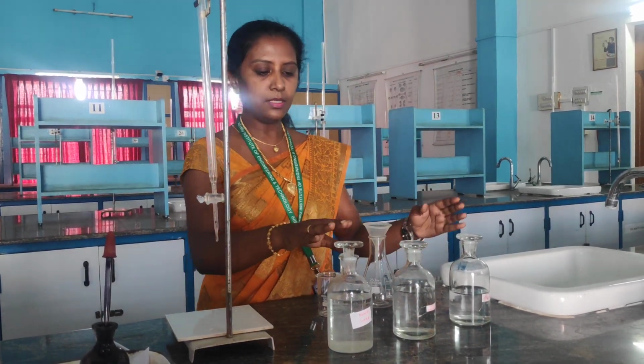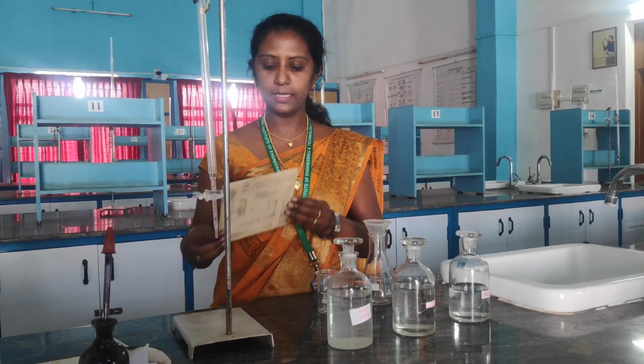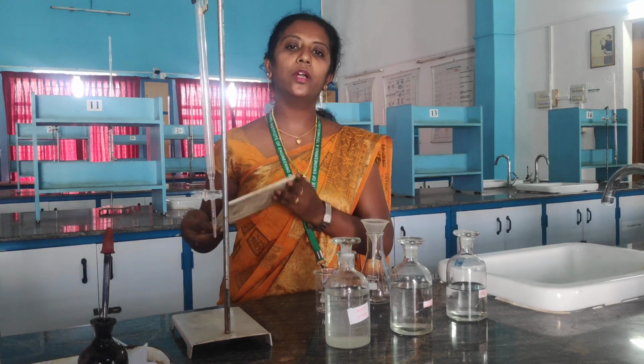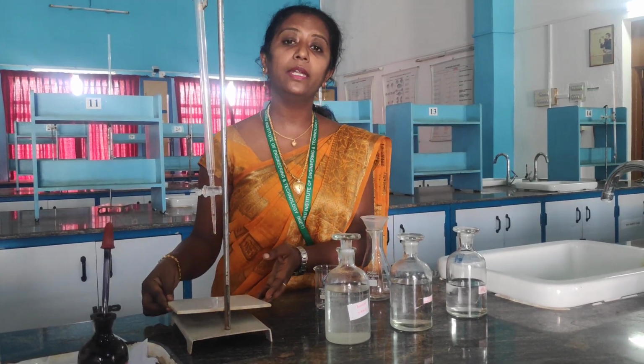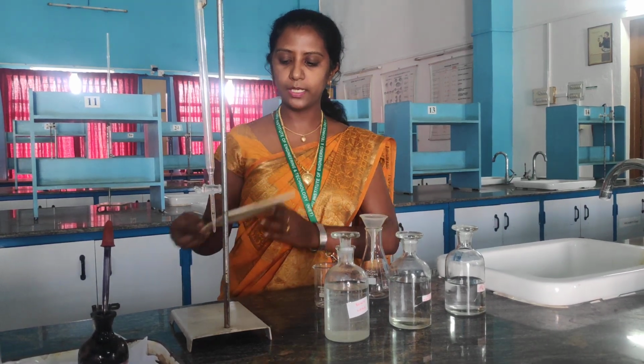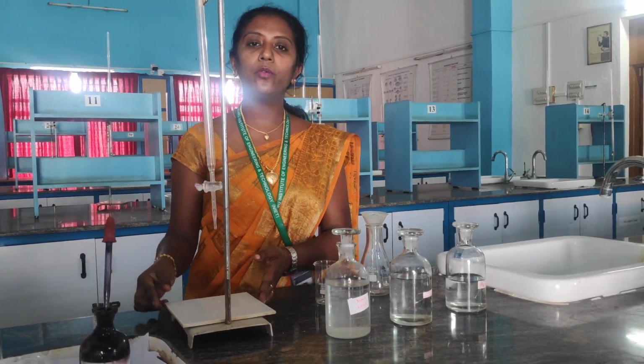Other than this we have porcelain tiles. The work of this porcelain tile is that whenever we are doing the titration, we need to identify the end point. For that purpose, we are using these porcelain tiles. So let me move into the experiment.